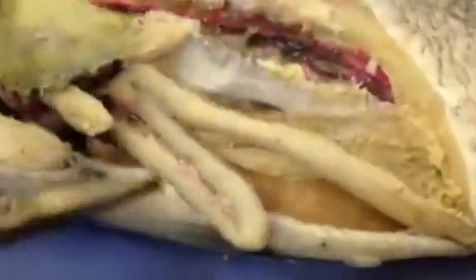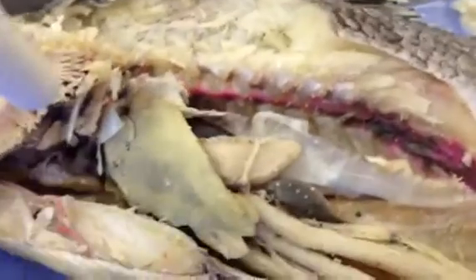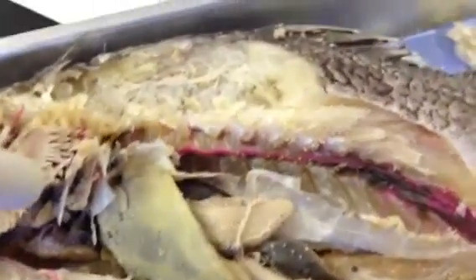And then when we go back to the gut cavity, the spleen, I think I took out my spleen. The spleen is right here. It's like a dark thing. This is the spleen right here. So that's the spleen. Yeah, we can see the spleen very well.